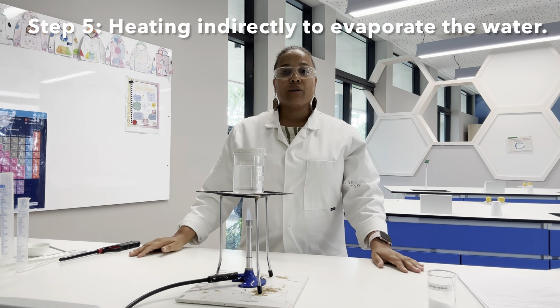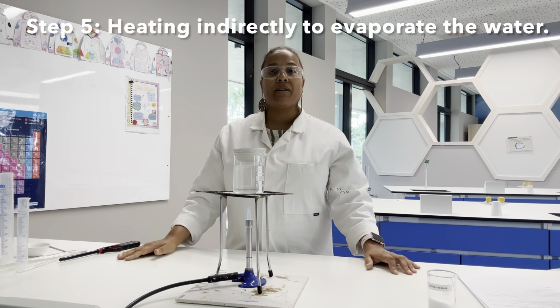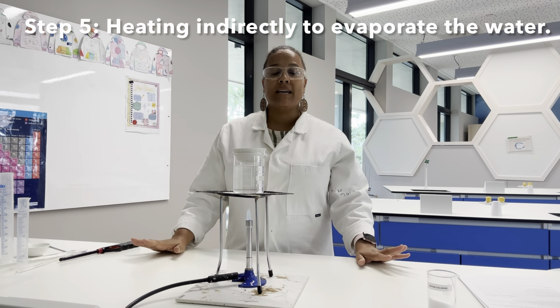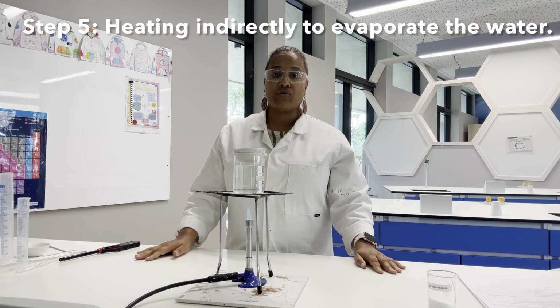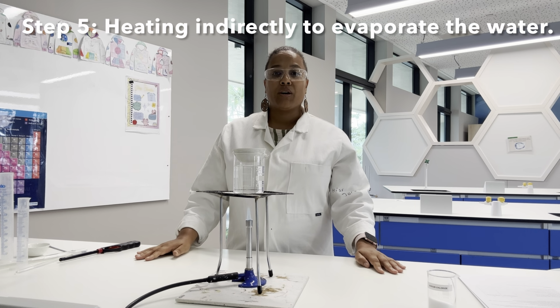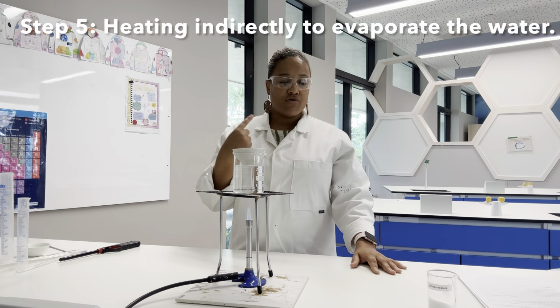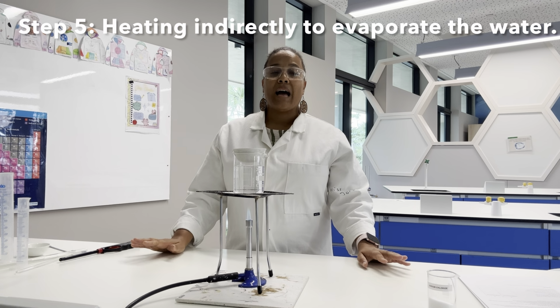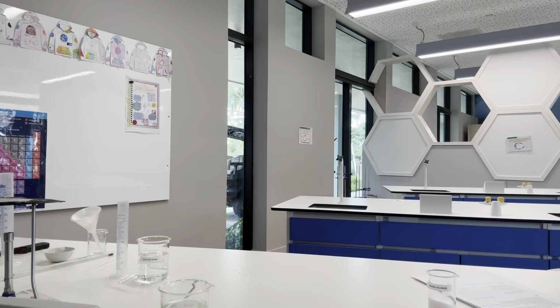So I've got my flame going, and I'm going to heat it up until we start to see crystals forming around the edge. We're not going to heat it until dryness, which means we're not going to heat it until all of the liquid has gone, because this could lead to thermal decomposition of those crystals. So we're going to heat it until lots of the water has evaporated and we start to see crystals, and we're going to leave it overnight for the rest of the water to evaporate, and then we'll be in a position to measure the mass of our crystals inside our evaporating basin.